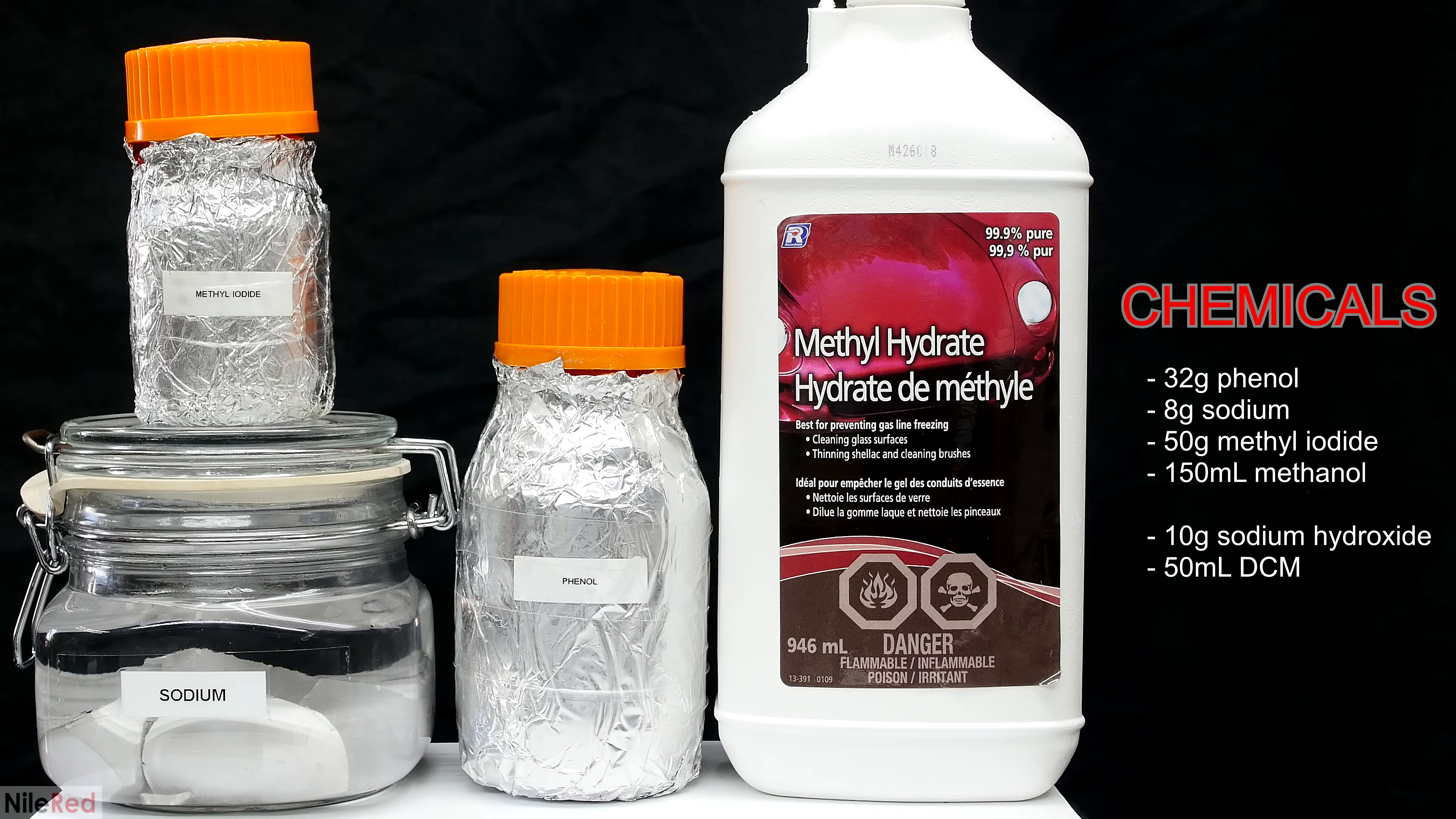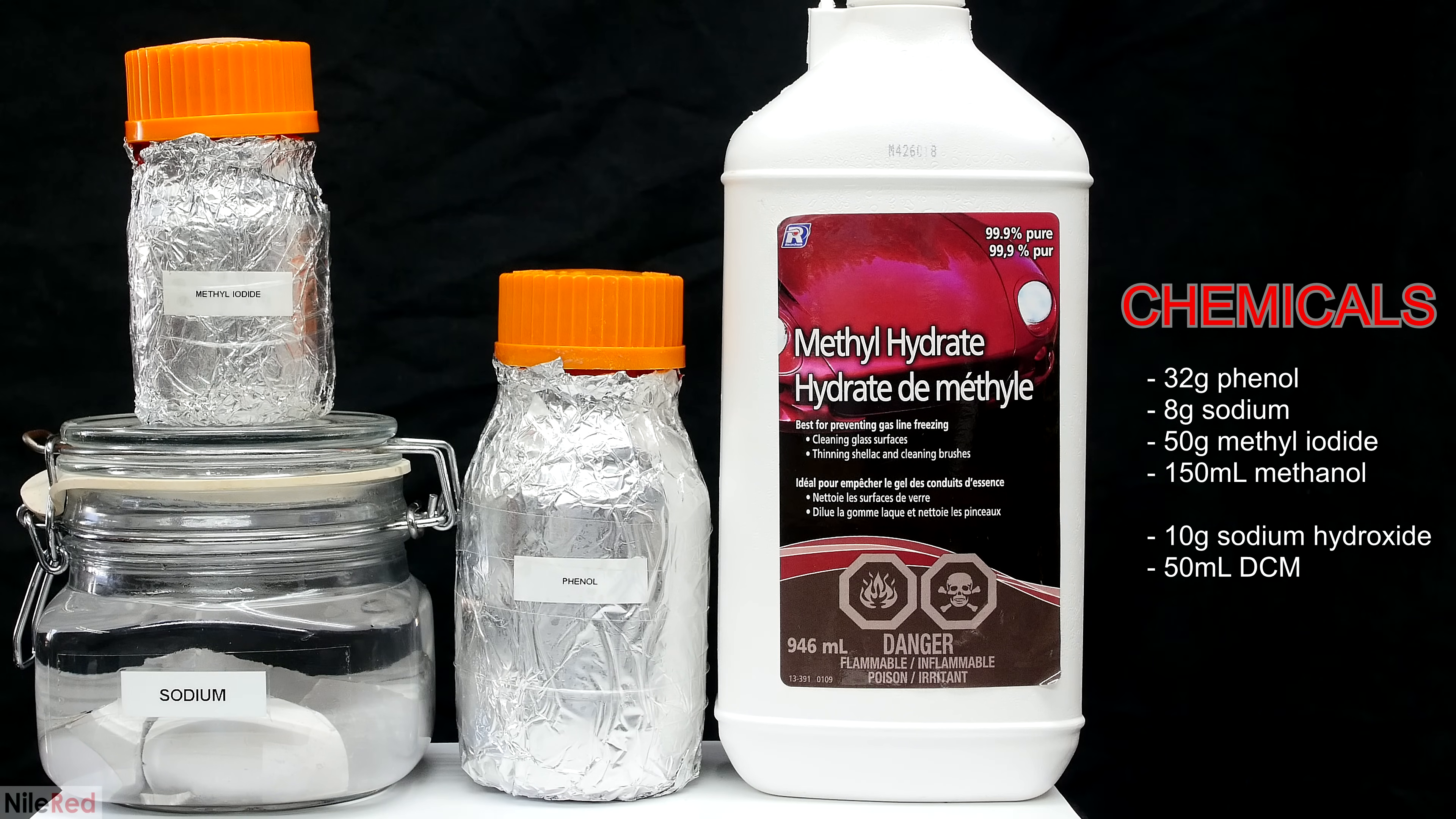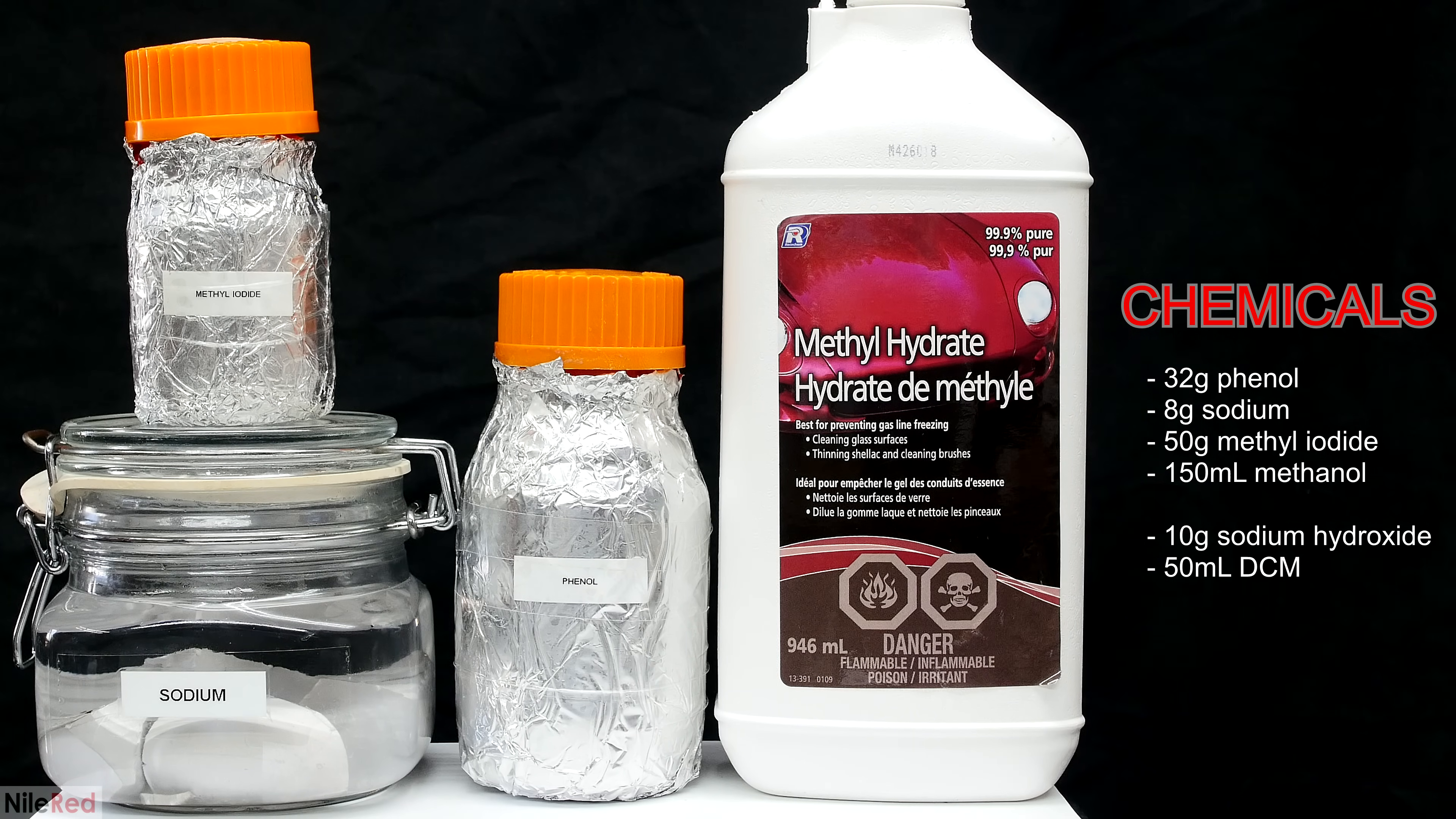In terms of chemicals, we have four major reagents: sodium metal, methyl iodide, phenol, and methanol. We'll also need some sodium hydroxide, some dry calcium chloride, and some dichloromethane for the workup.